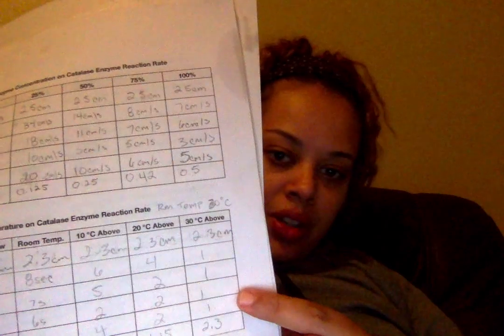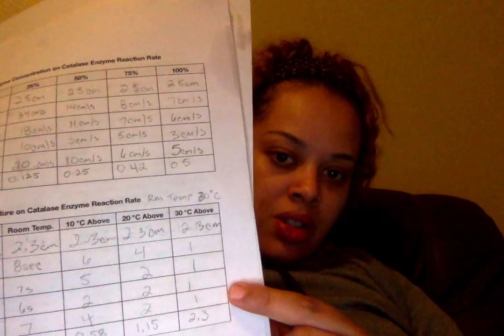At 20 degrees Celsius above room temperature it was faster, and at 30 degrees Celsius above room temperature the reaction rate became faster as well. It was most optimal at 30 degrees Celsius above room temperature.